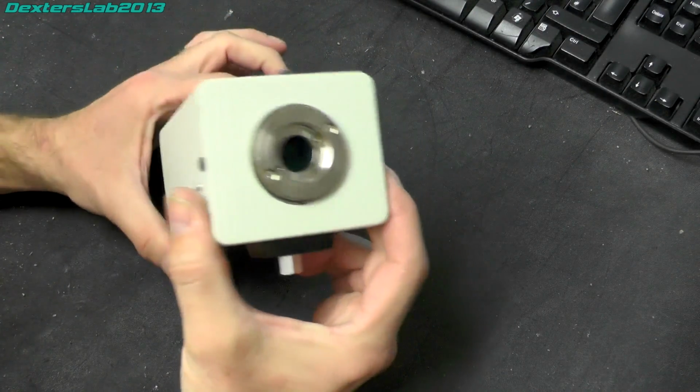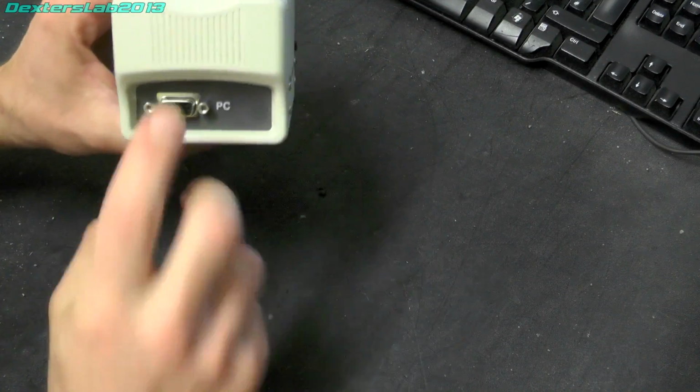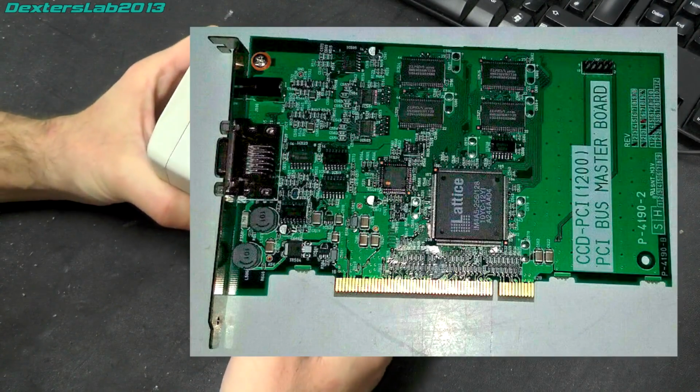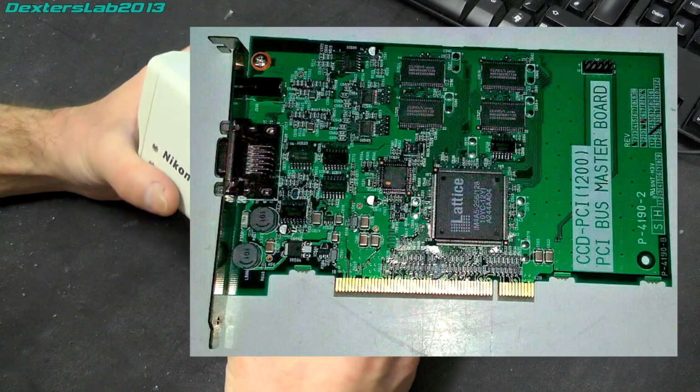So this would have been used in conjunction with a PC. This would have connected through to a computer with an interface card on it. And that would have provided software for doing all the actual exposuring and all that sort of stuff, actually taking the photo.